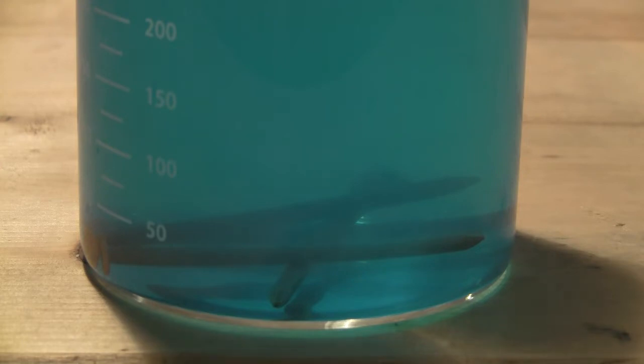Since the nails I have are galvanized, I added about two to three milliliters of three molar hydrochloric acid to dissolve off the zinc to expose the iron underneath. The concentration of hydrochloric acid is not too important, but do not add too much acid as it will start to react with iron and dissolve it as well.